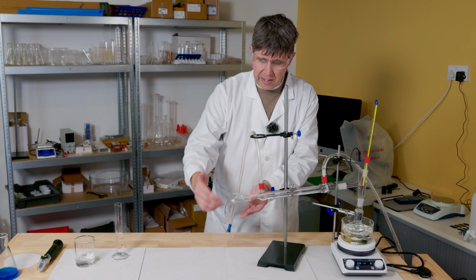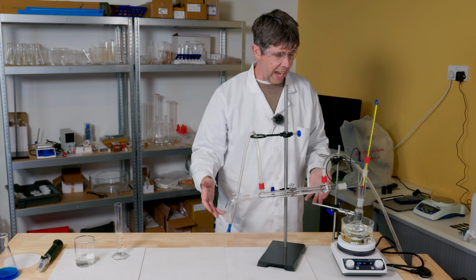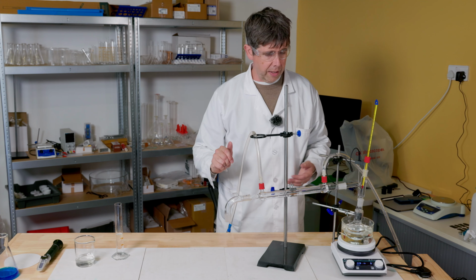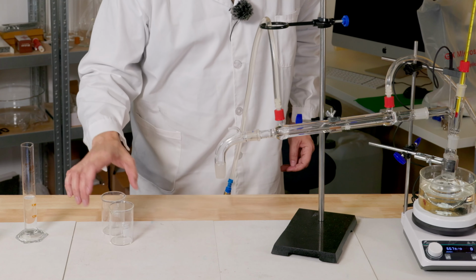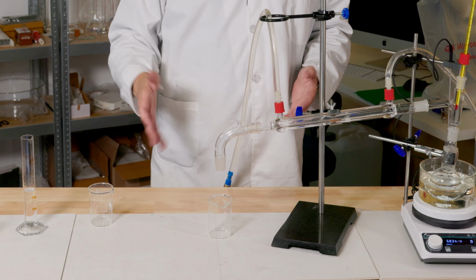help the liquid eventually come down into a beaker, which I'll place here in a moment to catch the ethanol as it condenses inside my Liebig condenser. And I've got 2 little beakers set up here ready to go. One to collect the first few centimetres cubed, which may or may not be pure, and then one to collect the majority of my sample, which I will then test.